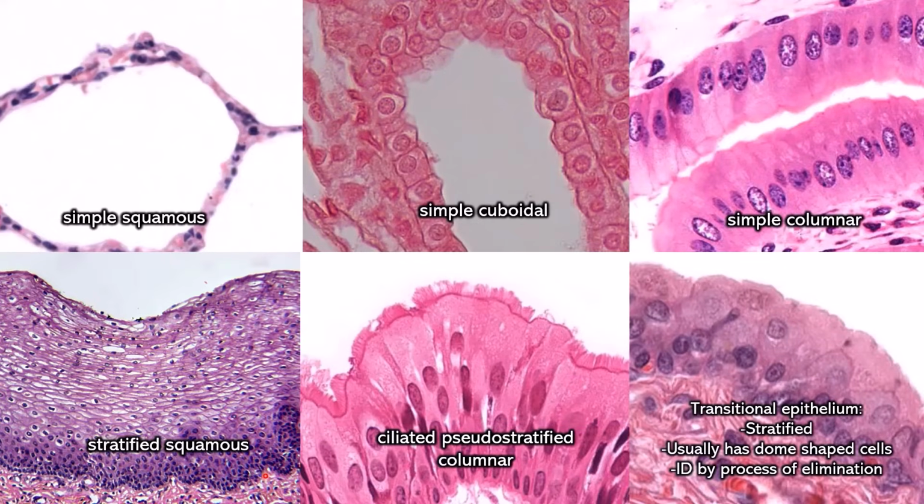If we look at this first example, we know that it is simple squamous because simple tissues have one layer. Squamous cells are flat. And because of how thin this is, you should recognize that this could only be one layer of flat cells. You should also know that it's not adipose because you're seeing many nuclei here, and in adipose, the bubble that you're seeing is one cell, therefore there will only be one nucleus in the bubble.